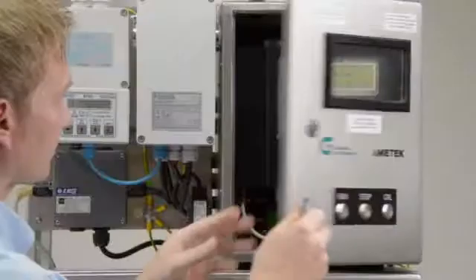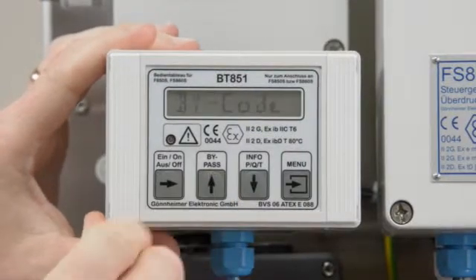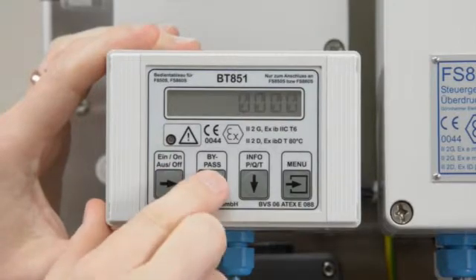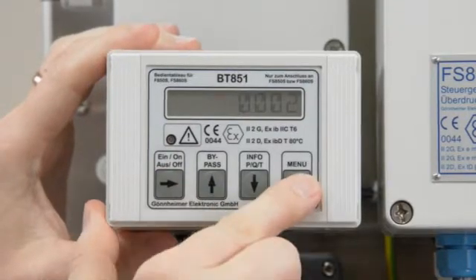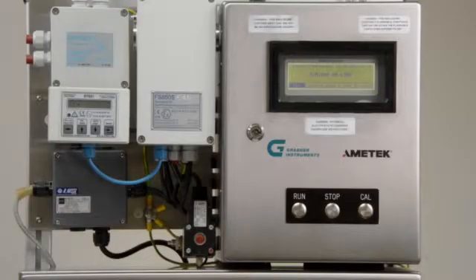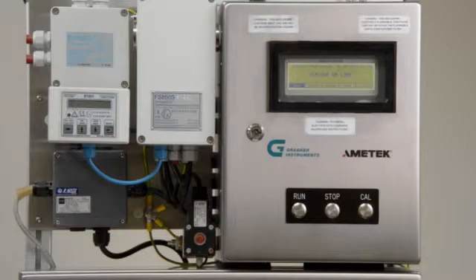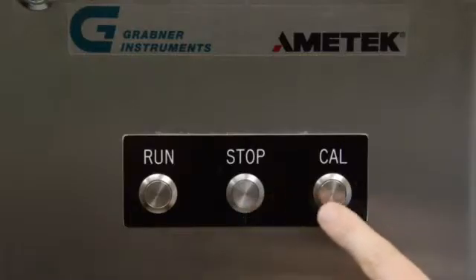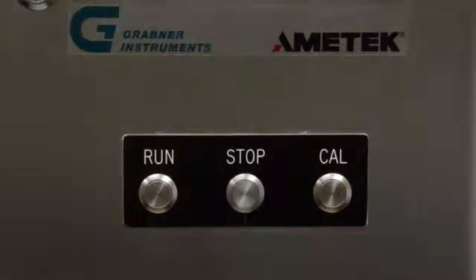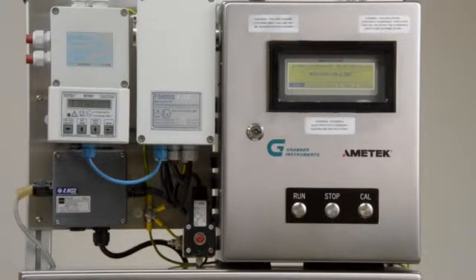Measuring. When all parameters are set, close the cabinet, then activate the purge control. Then press Run. The cabinet is purged and the measuring cycle starts, using the preprogrammed methods and measuring intervals. Press Stop to stop the measurement, or Cal to start a manual calibration run. After the measurement, the result is displayed and results data is transferred.